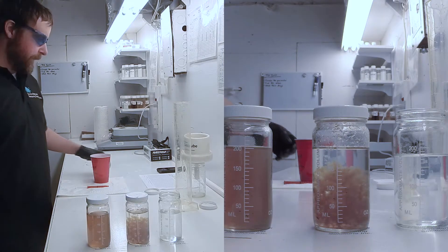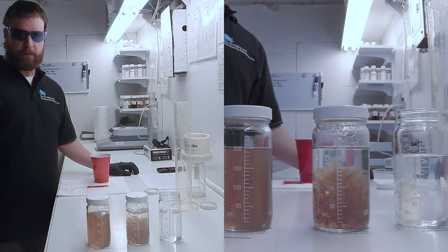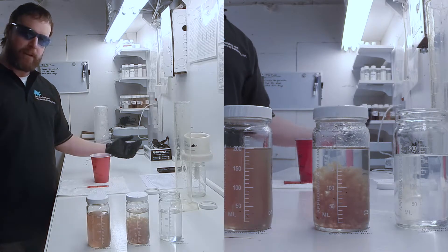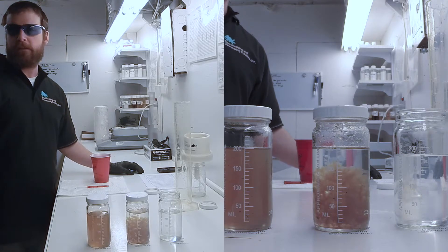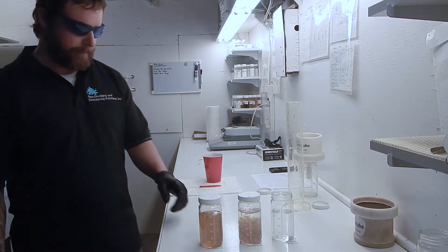So there you have it. That's one simple RDT test. And we use that first to help determine which polymer we'll use. And that leads into our next test, the GDT or Geotube dewatering test. Thank you.